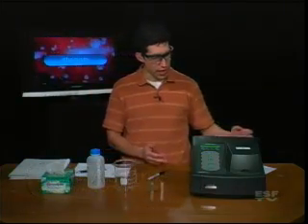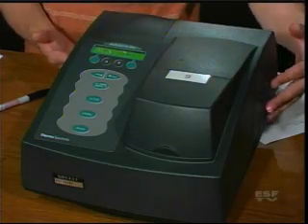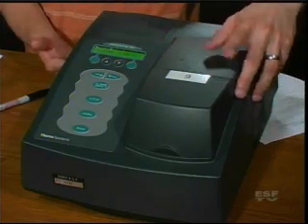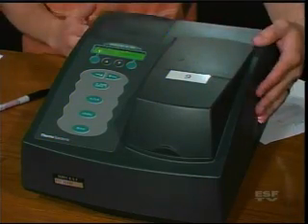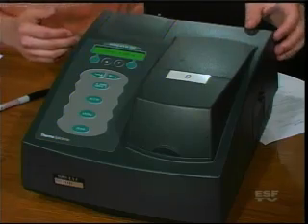Hi, and welcome back. In today's segment, we're going to talk about the spectrometer, which is a common analytical instrument in the lab. And you can see right here, we have a spectrometer. In this case, you can see by the number nine, that is the ninth spectrometer we have, but not a big concern.